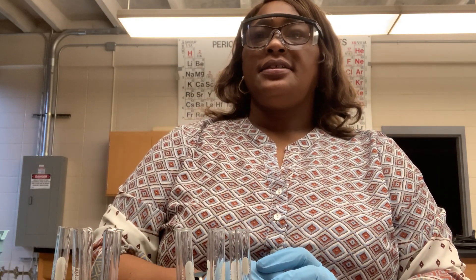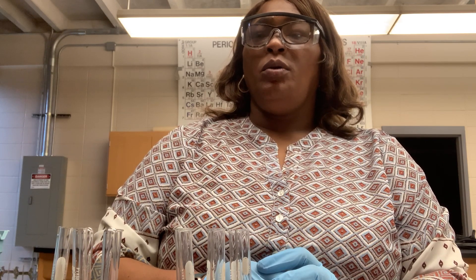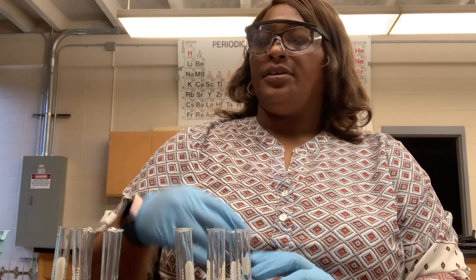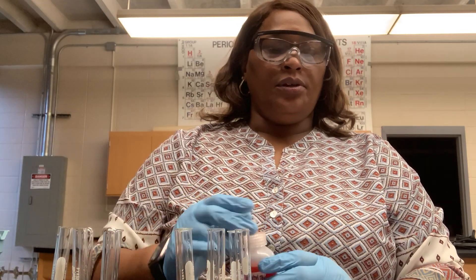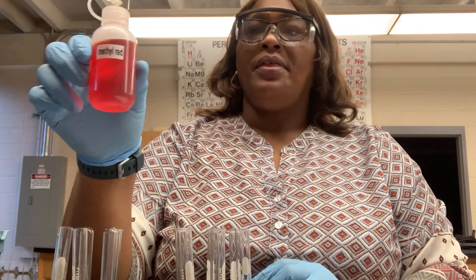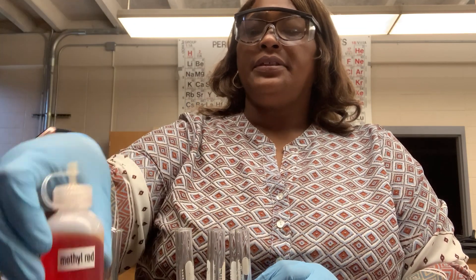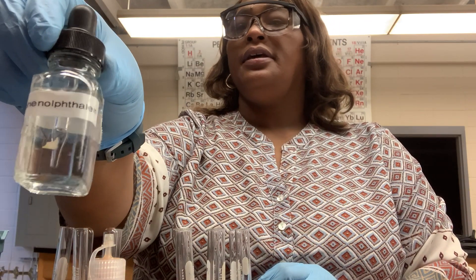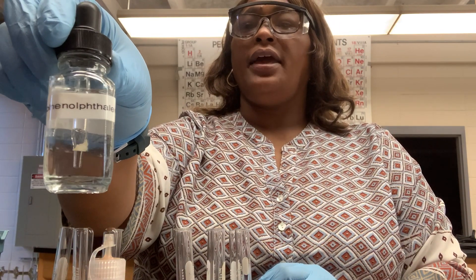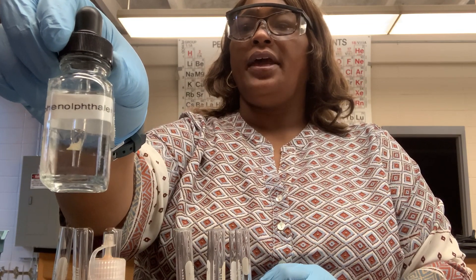For the first test in determining pH, we will use indicators. We will be using two types of indicators. The first indicator that we will use is called methyl red. The second indicator that we will use is phenolphthalein.